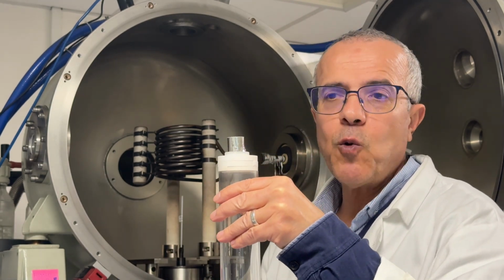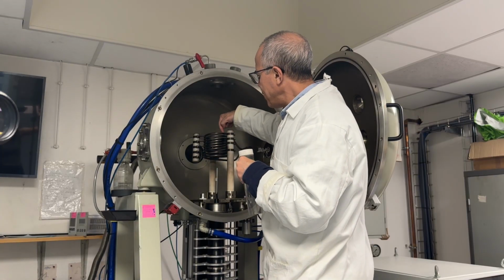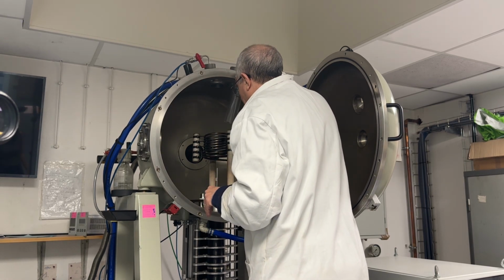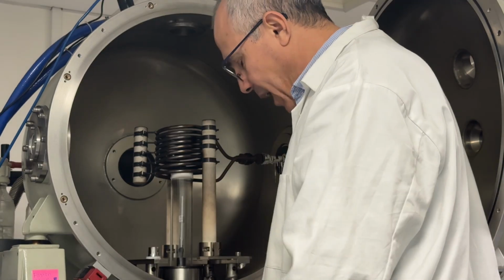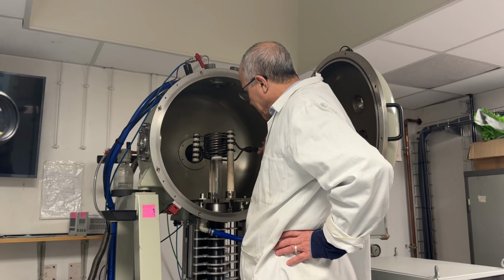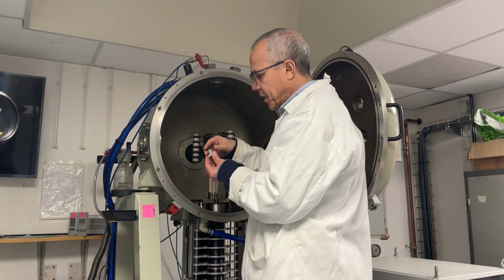So that is why when we do crystal, we take our time. There is the RF. So now my quartz tube will go inside the RF and I install it. I have two movements, X and Y, to align the seed holder. You have seen that I put the quartz tube and now I put the after heater.